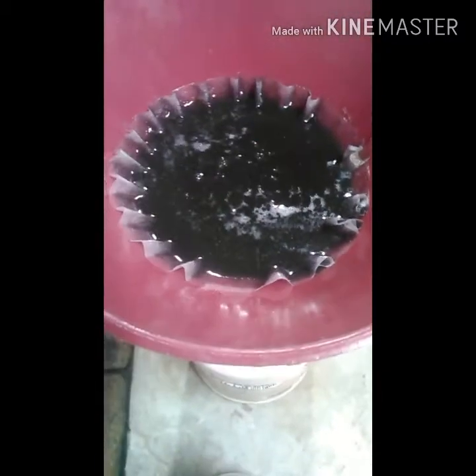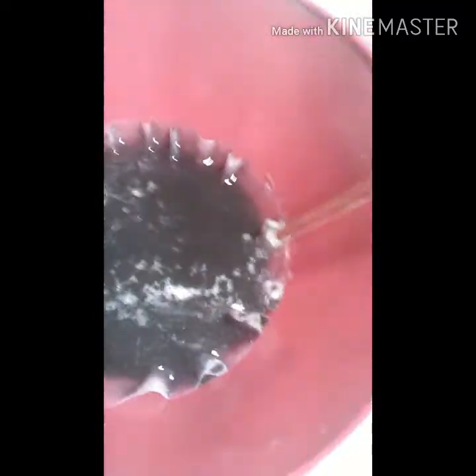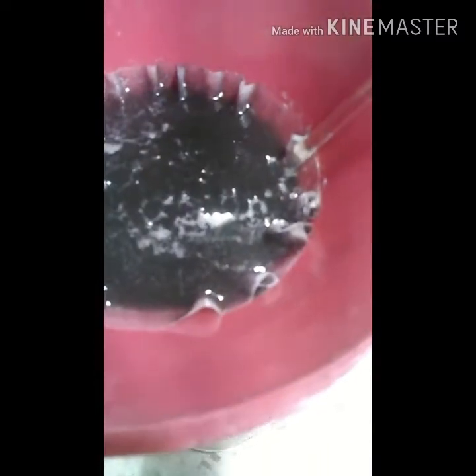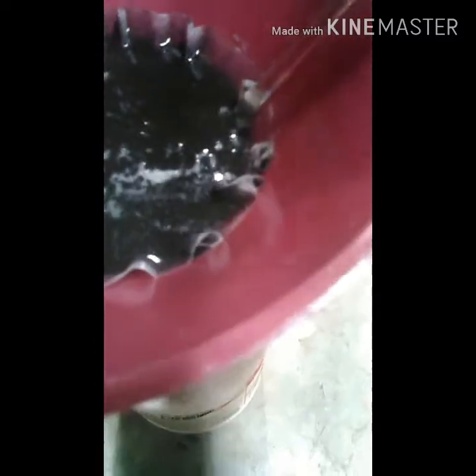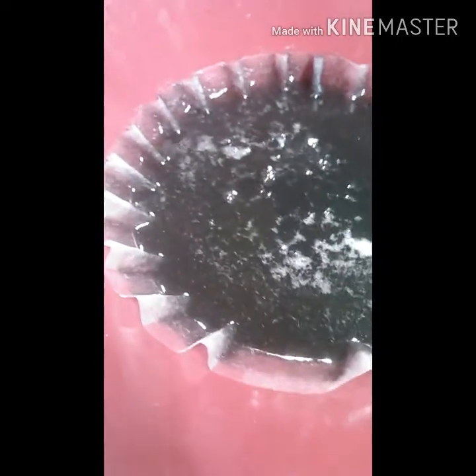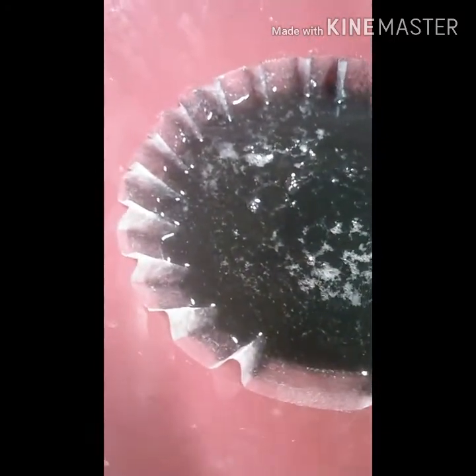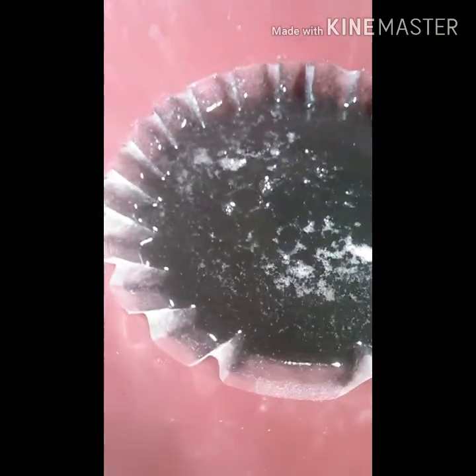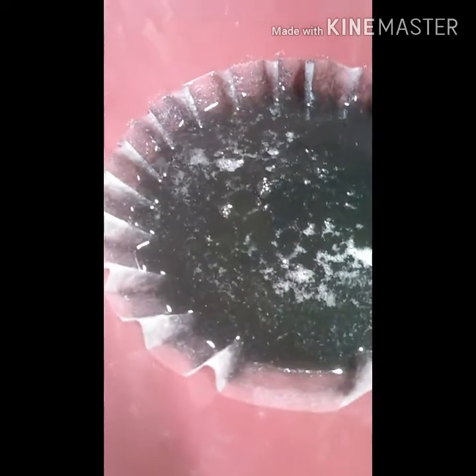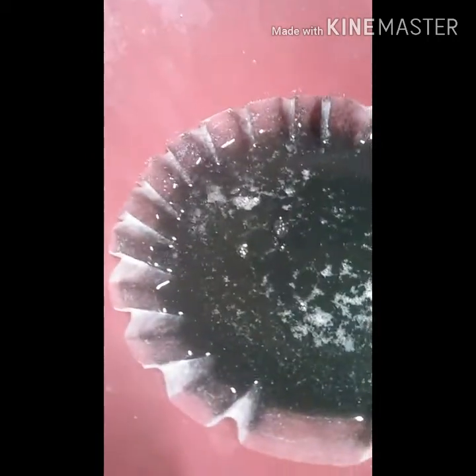This is me filtering it. I've got a stir rod in here — this funnel fits the jug rather well and doesn't let air out, so for every drop that goes in, air has to come out, and this is basically a way to let air burp out. When you're filtering, you want as many ridges or ripples in the filter as possible, because the more surface area that filters, the faster it'll be. If the filter is just sitting flat against the funnel's plastic, that paper's not doing anything. The more surface area the liquid can get through, the better.